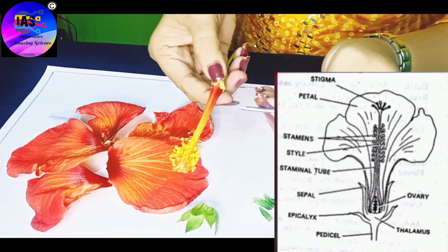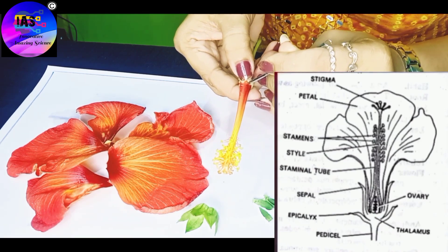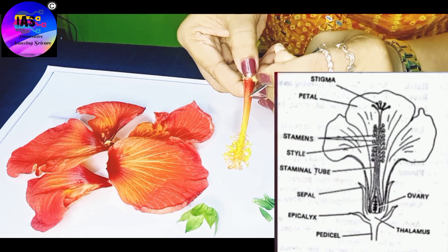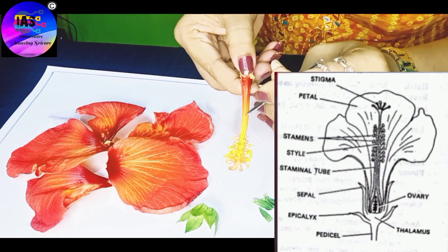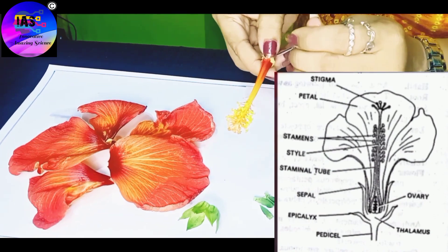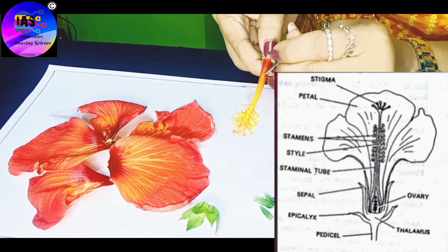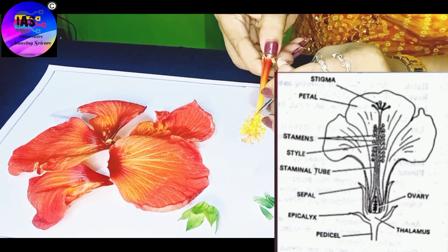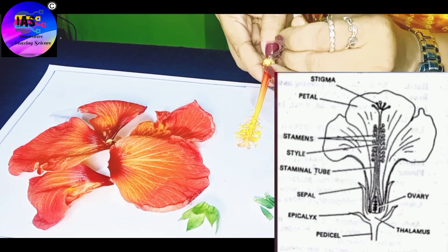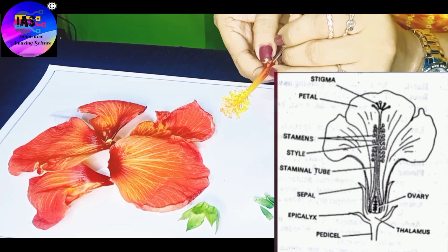Next is the gynoecium and the androecium. I'm holding the needle and trying to pierce the staminal tube because inside the staminal tube you'll find the pistil, so you have to be very careful.